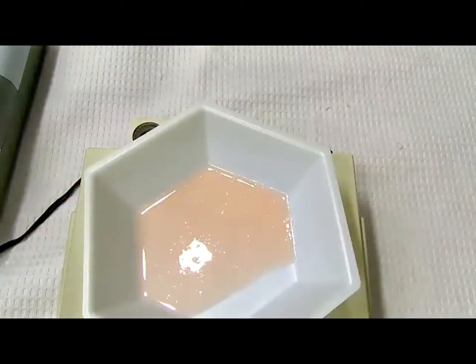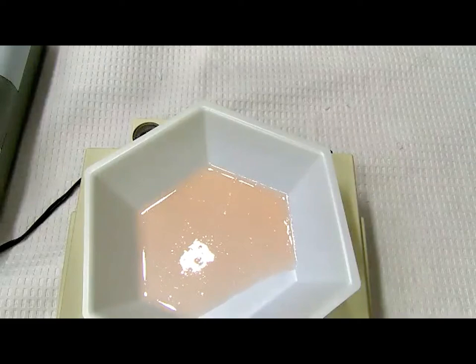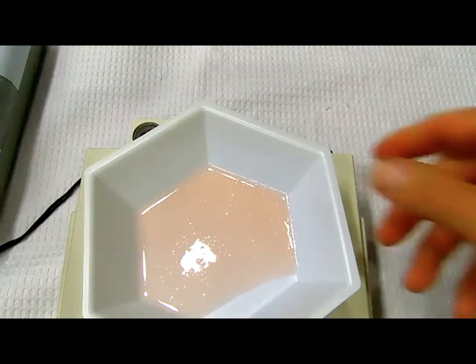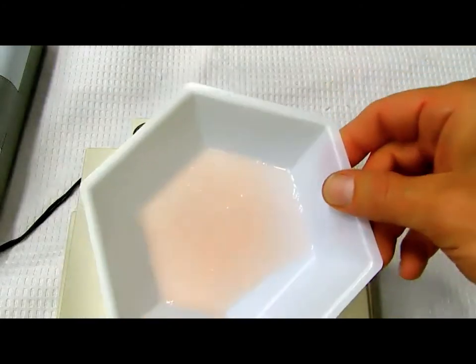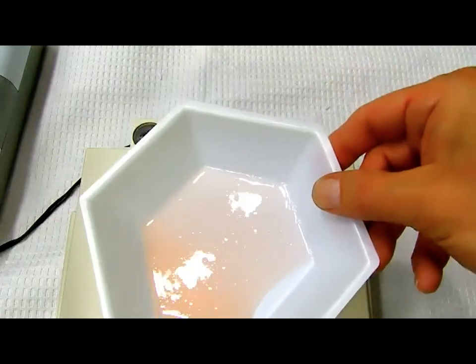It is a pink. Let's take a big whiff of it. I just smelled it and I didn't smell anything. So what is our term? When you don't smell anything, let's call it odorless. So it's a pink, odorless. Would you agree, is that clear? Because the ingredients were clear to begin with, but it's not clear. That is definitely opaque, okay?